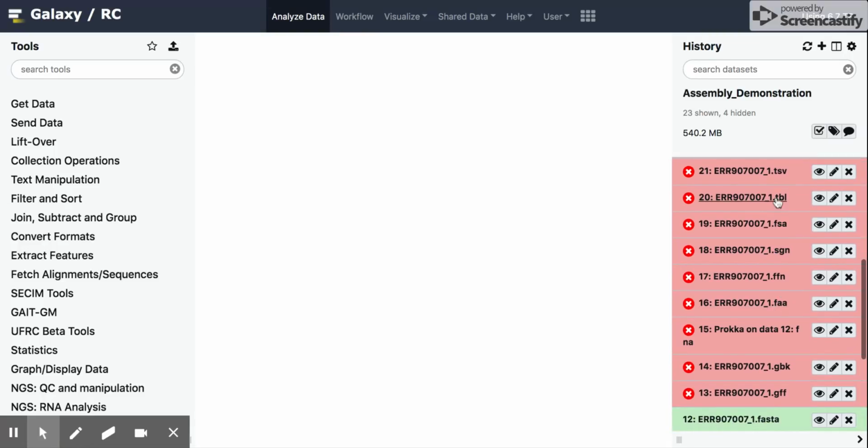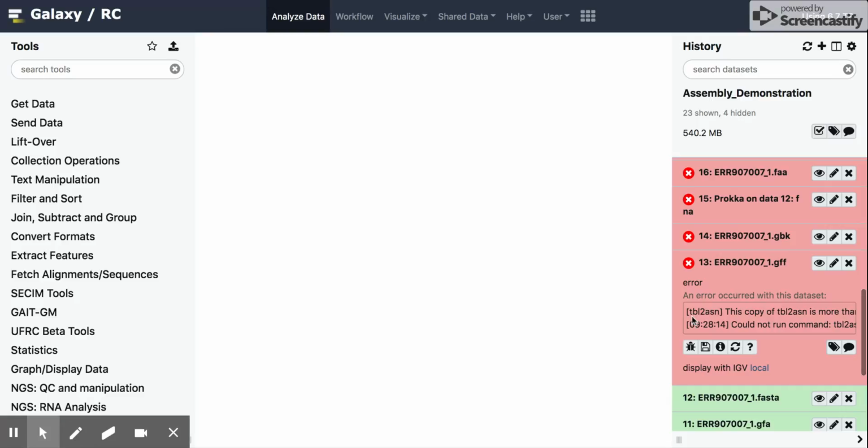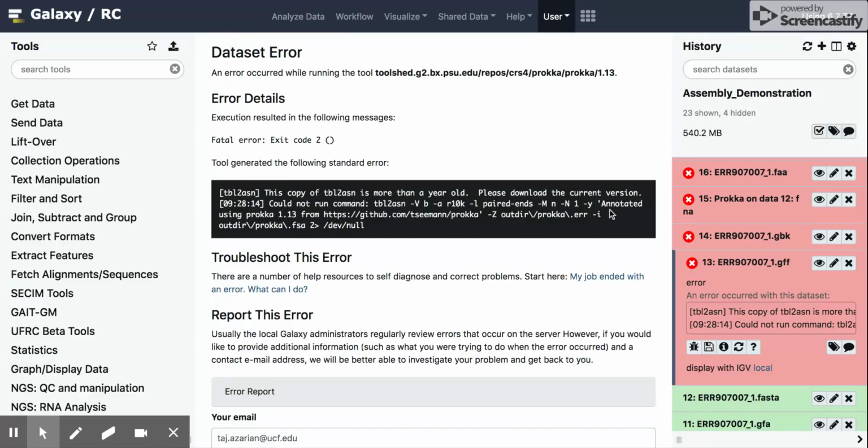So we can see everything in here is red. That means that Prokka was unable to run. If we click on it, you see it says error, and we get a peek at this error. If we click this little bug over here, it says view or report this error. When we click on it, we can see this error in this black box right here. Tool generated the following standard error: the copy of tbl2asn is more than a year old.